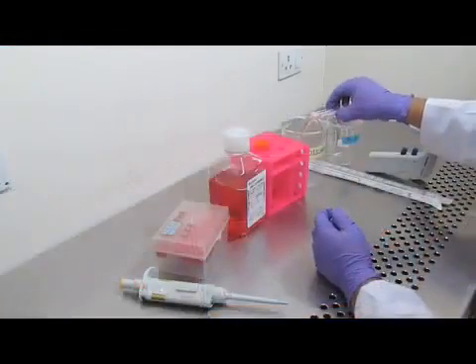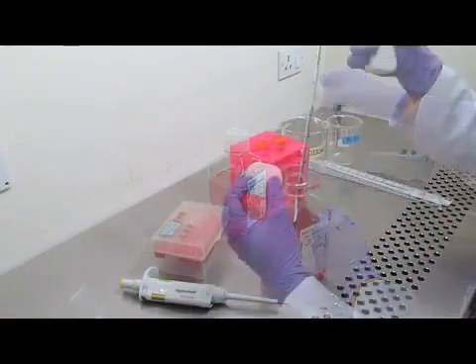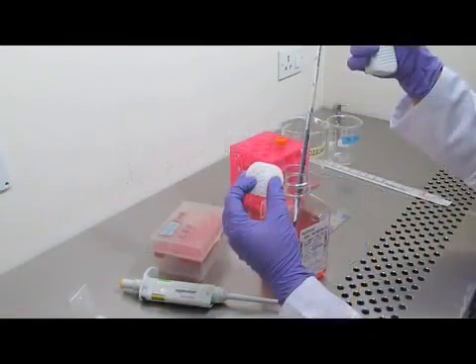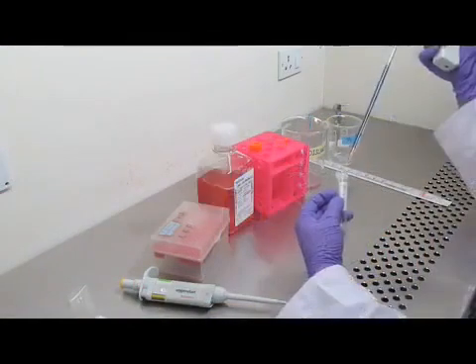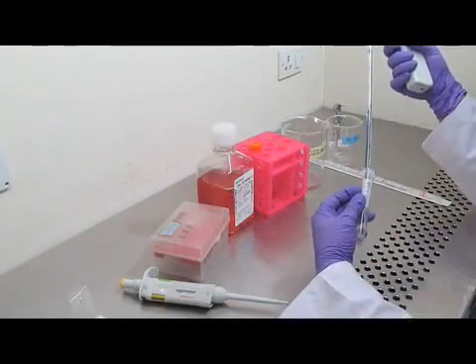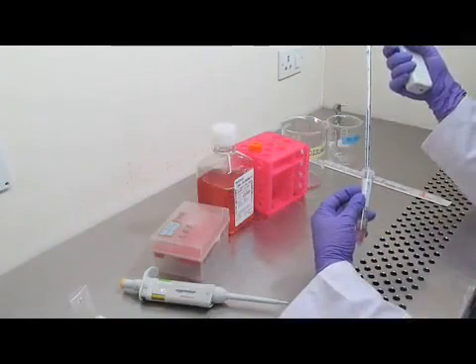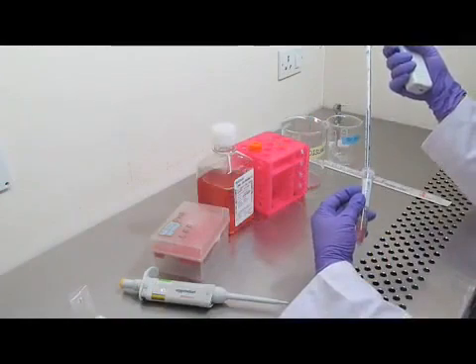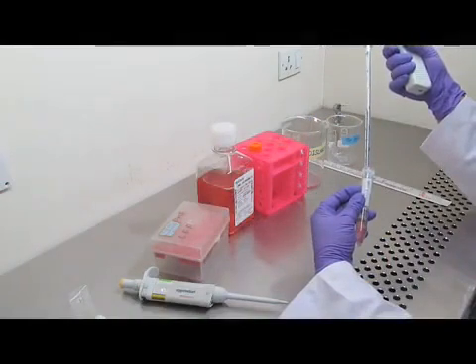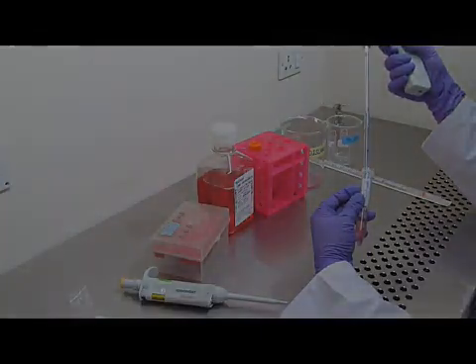Decant the medium into a waste container. Add 5 ml pre-warmed RPMI medium into the tube and re-suspend the THP1 cell pellet by gently pipetting the medium 3 to 4 times.